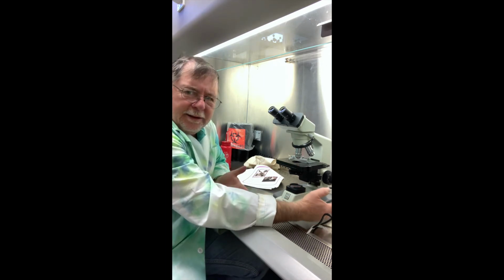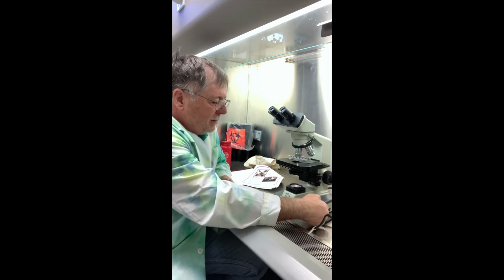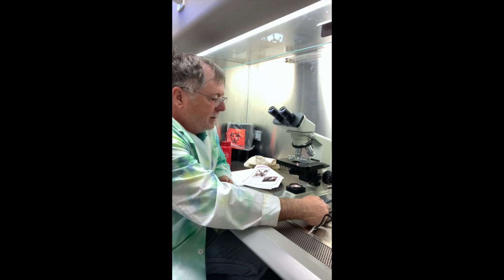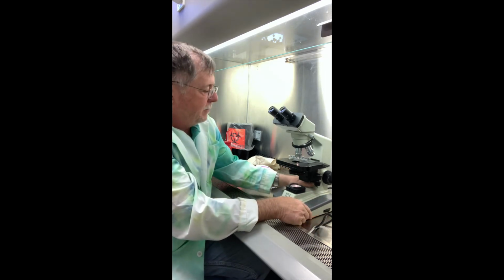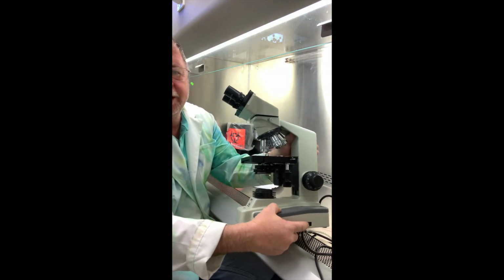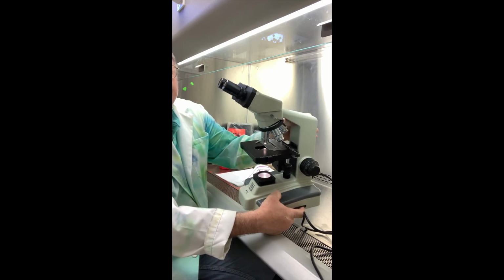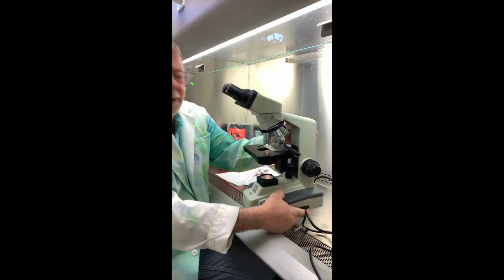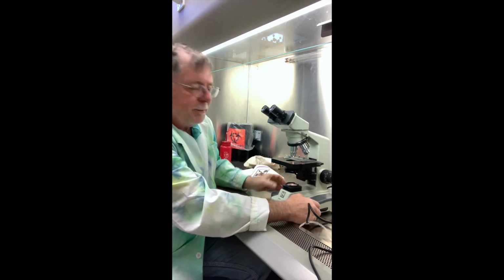and everything's backwards on this scope, or on this video, I think. And so you want to go to the right side as you look at the scope, and there's a dial here. Okay. And so we're going to take that and we rotate it, and it makes it brighter. See, you can see the light getting brighter or dimmer. And generally, the higher power, so we want to have more light.